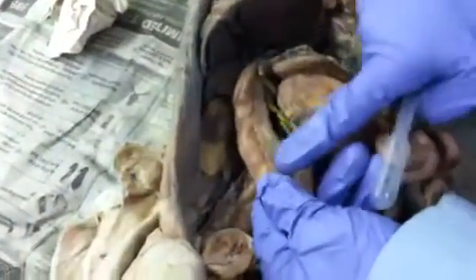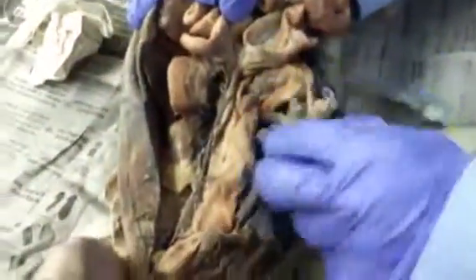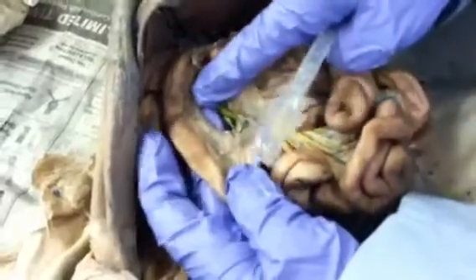The duodenum has the pancreas in its fold, and the pancreas goes all the way from the duodenum over to the spleen in general. But this is a really small cat. This is the spleen right here. Oh, I mean pancreas. The pancreas is right in the curve of the duodenum, and it usually goes all the way over to your spleen. But here's some pancreas there. That's pancreas, and this is pancreas.